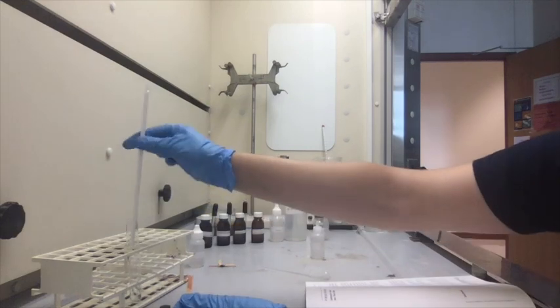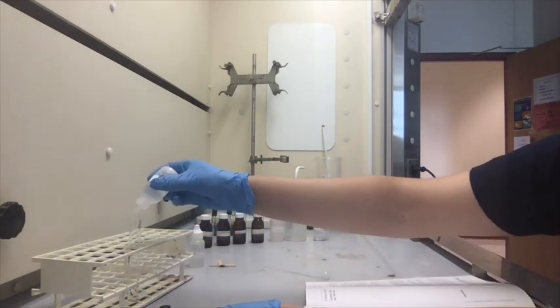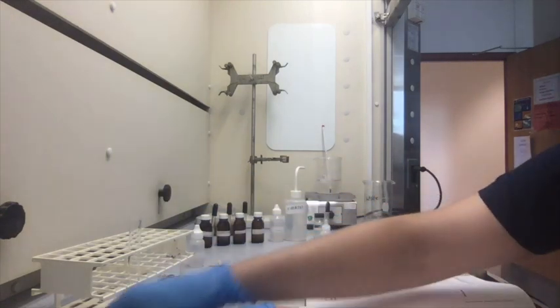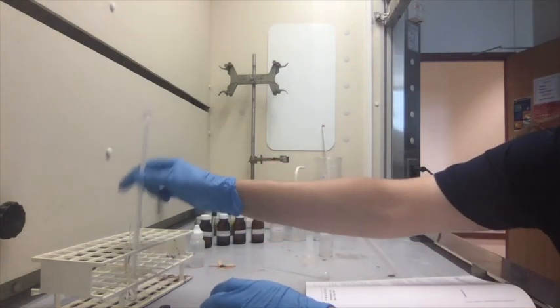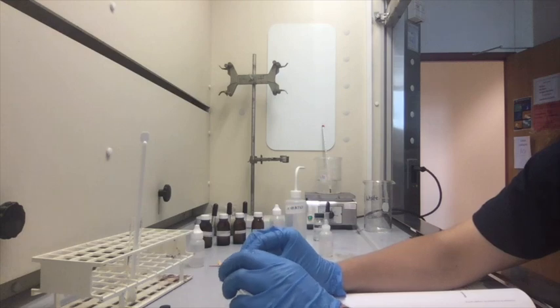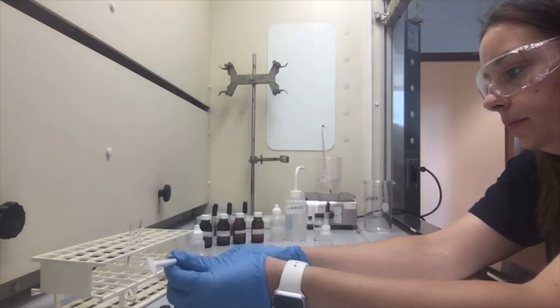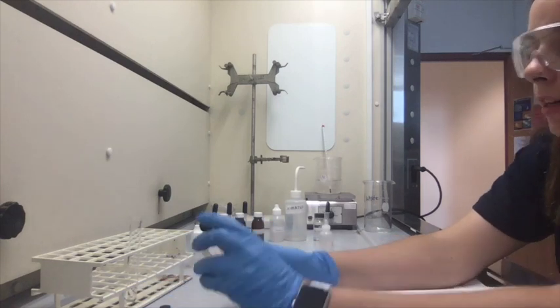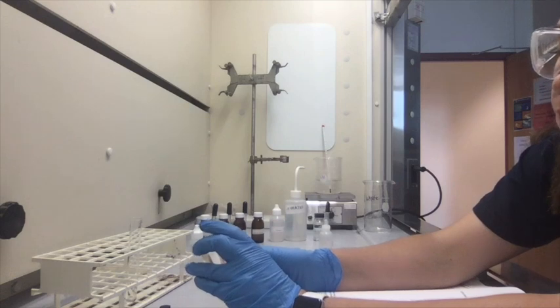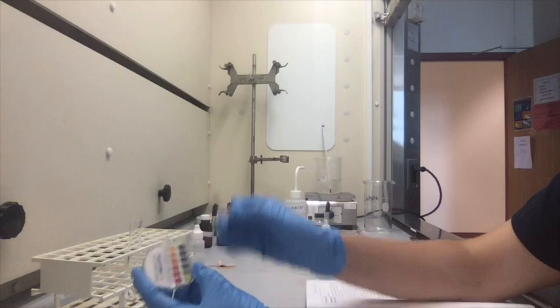So we'll add maybe 3 more drops, just so it's acidic enough. So 1, 2, 3, and then we're going to mix that. Here we go. And now we've got a pH of 4. Alright.